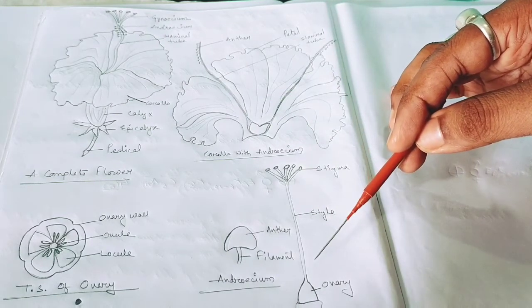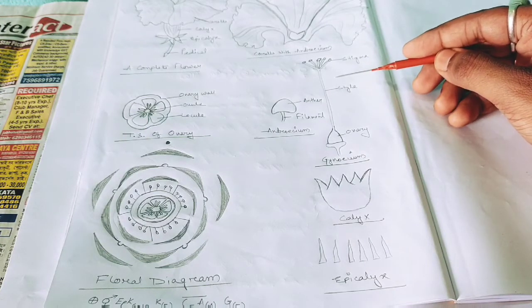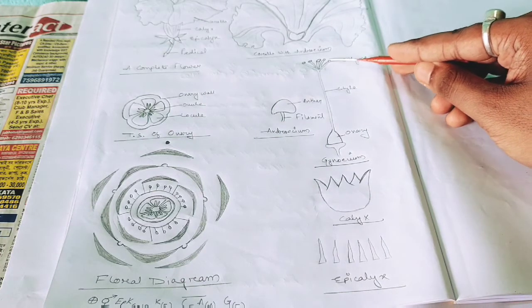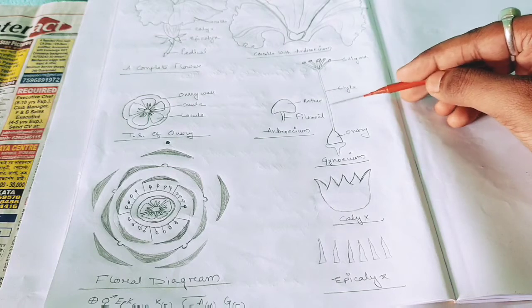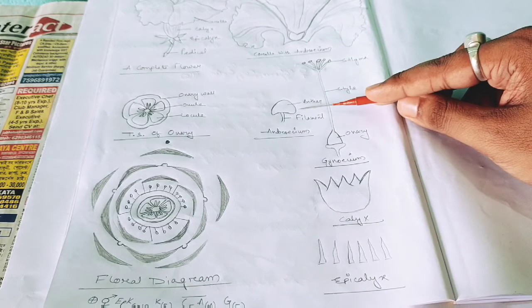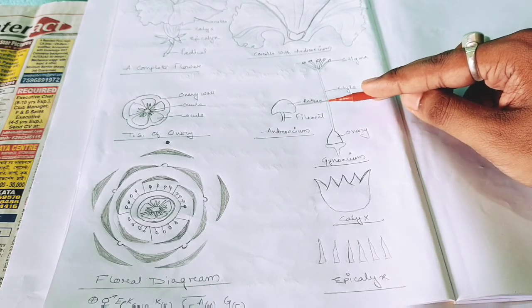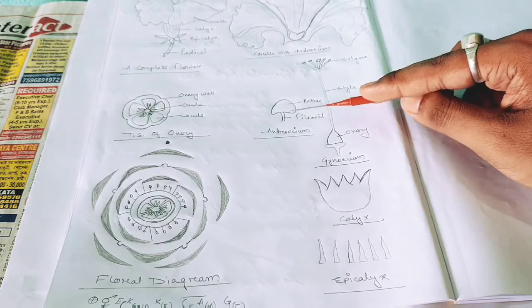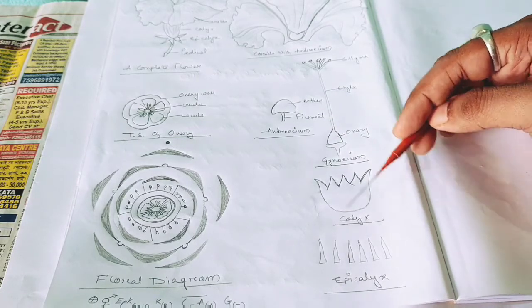Now it is the gynoecium part. As I have said that I will explain it in a diagram, so it is a stigma. You can see it is a free stigma. It is a style. It is single and long. It is an ovary. It is a gynoecium part. It is an anther. As the anther is shown in the diagram, it is very small, so in the diagram you can see it is big. I have drawn it. The upper tip is called the anther, and this long part is the filament. It is the androecium. This is the calyx, and it is the epicalyx.